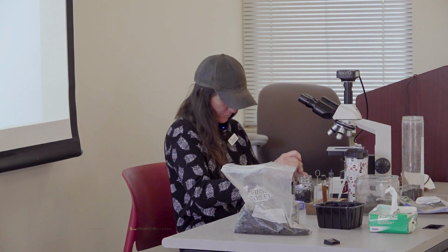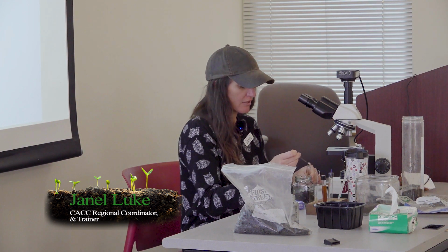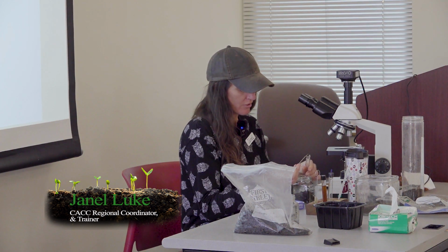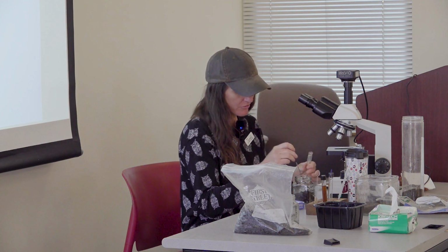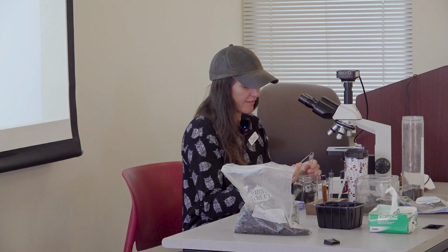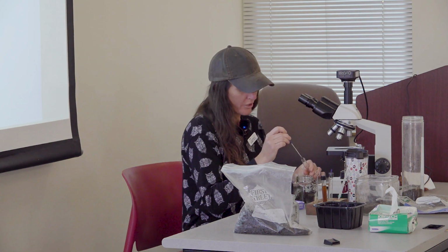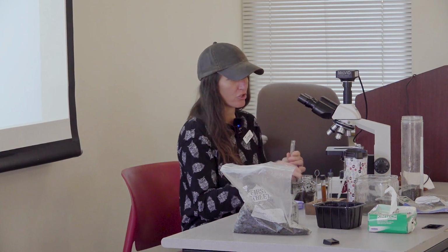So when we perform microscopy, and this was kind of the last slide I had on my other presentation, we are using a very particular type of microscope to do this. Microorganisms have the same refractive index as water, which just means that when you put them in an aqueous solution and try to shine a light through them, you're not going to see anything because they're clear.